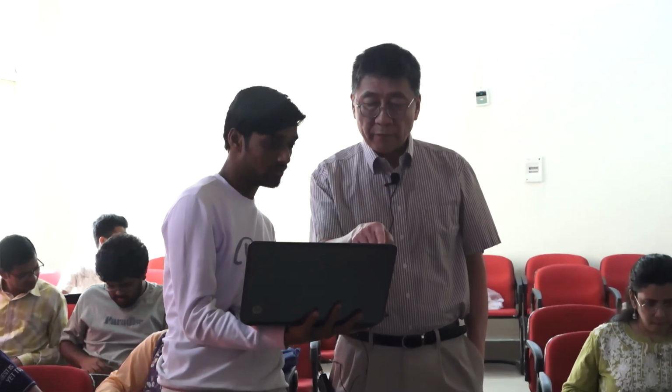Okay, you need to open the map. No, File. Don't click this icon, it only opens PDB files. So cancel. You need to open the map: File, Auto Open MTZ, and then the MTZ file. There you go. And then make the map smaller. Edit, Map Parameters, and make that 7. Okay.